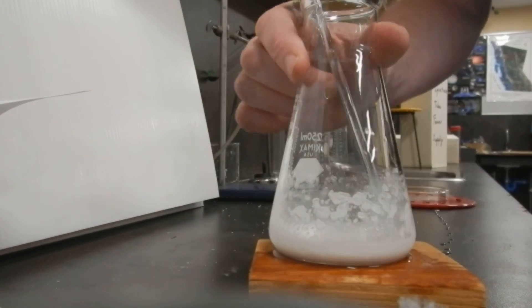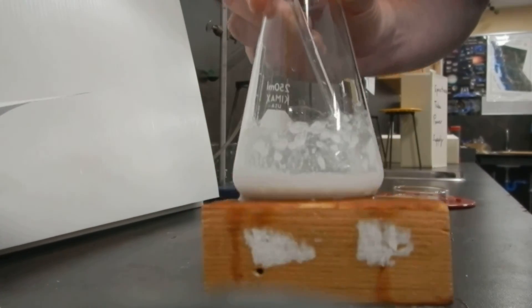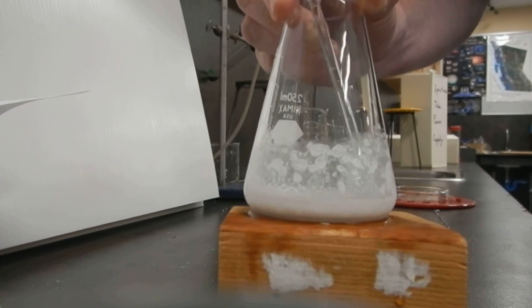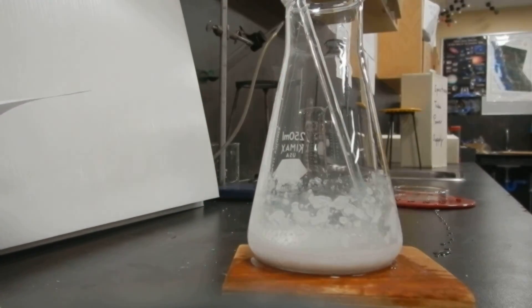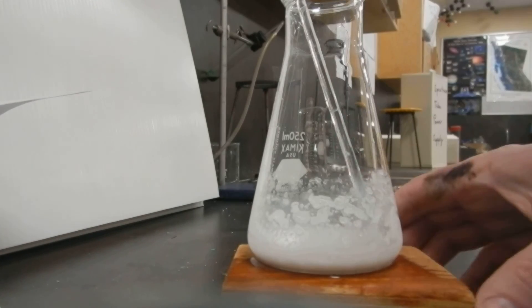Yikes, a lot of debris on that hand there. But it's still frozen. And it'll stay frozen probably for about 10 to 15 minutes. But what a nice, stinky reaction. Nothing beats a little ammonia.